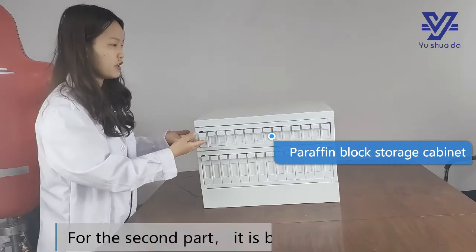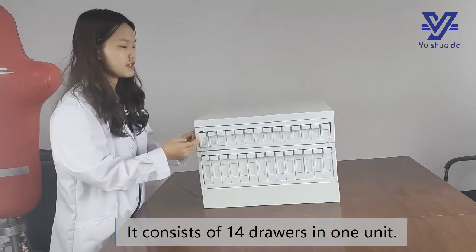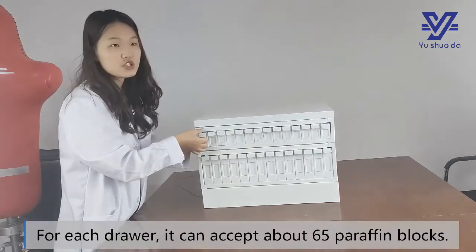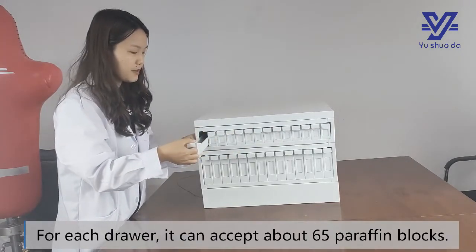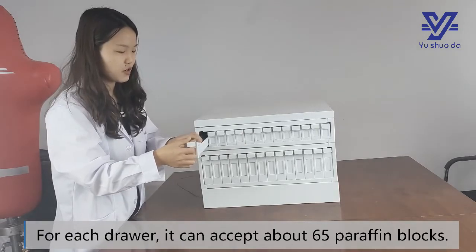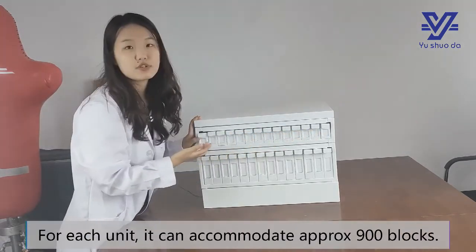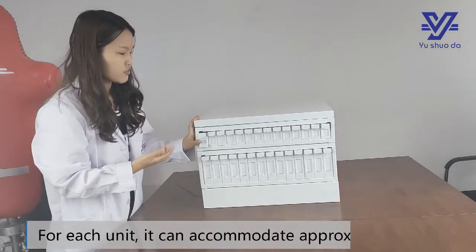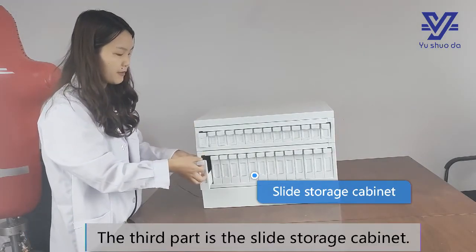The second part is the block storage cabinet. It consists of 14 drawers in one unit. For each drawer, it can accept about 65 blocks. And for each unit, it can accept approximately 900 blocks.